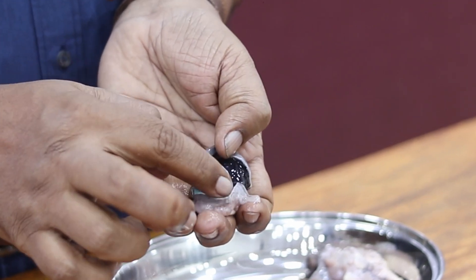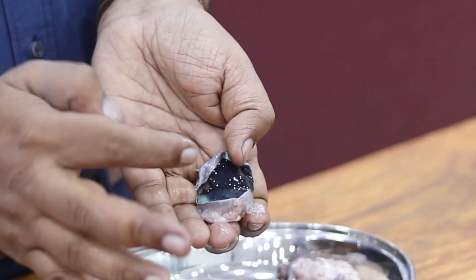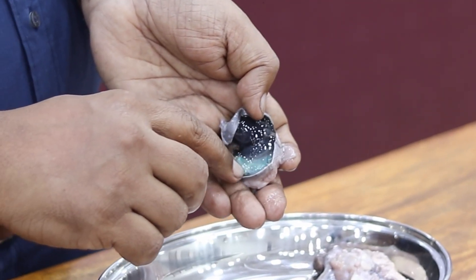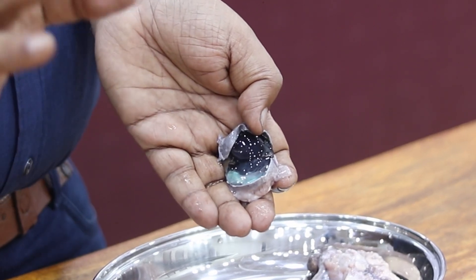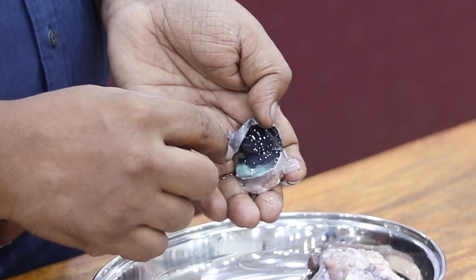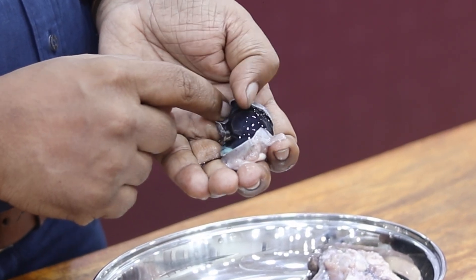This part is more jelly-like material — glass-like gel. Behind you can see a somewhat shiny layer. This explains how eyes shine at night when you flash a light on them. And then this is that transparent glass-like part.